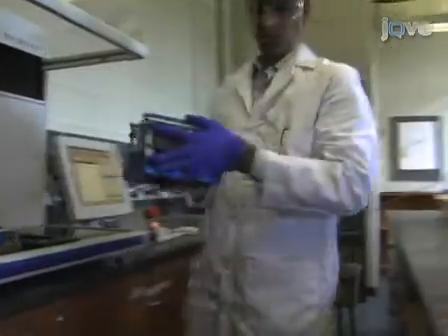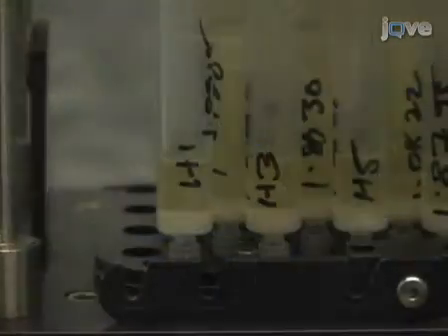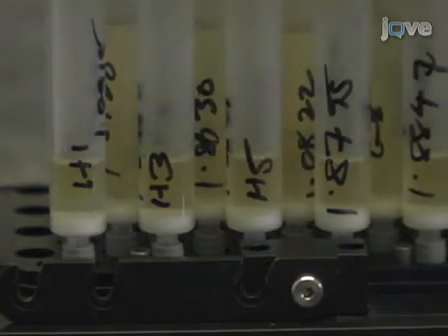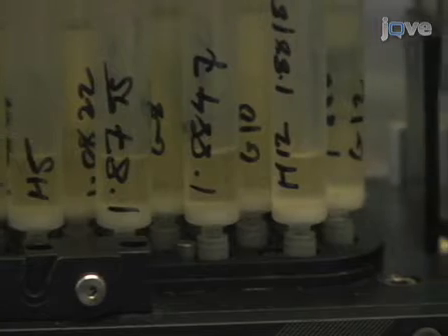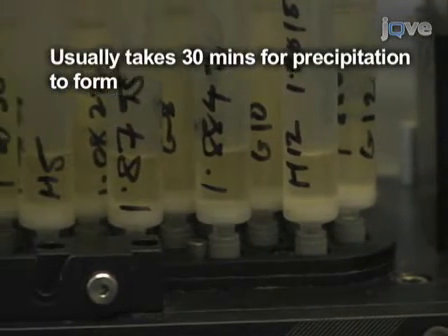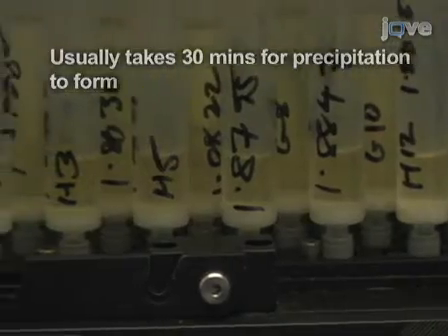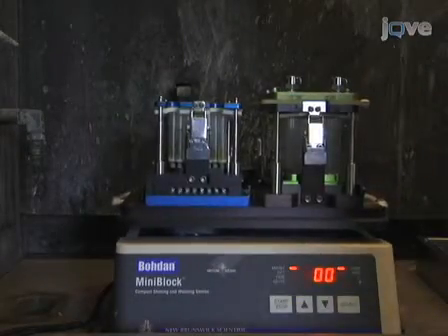The MiniBlock is then removed from the liquid handler. You can clearly see that there are clear solutions in each tube. This is important because you want to make sure that all the reagents are soluble in all the solvents. It usually takes about 30 minutes for the first precipitate to form. The MiniBlock is mounted onto a shaker and left to mix overnight.